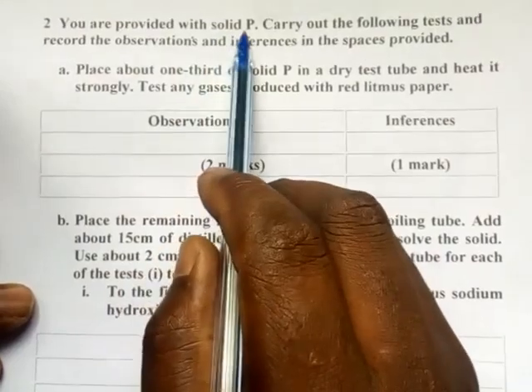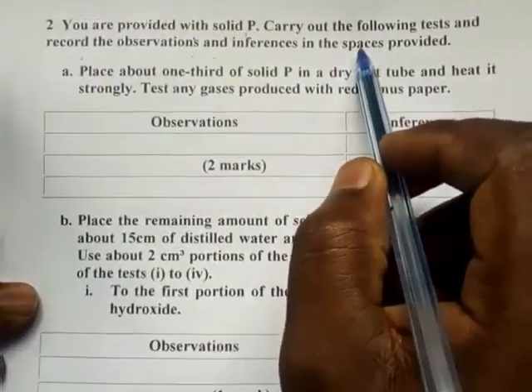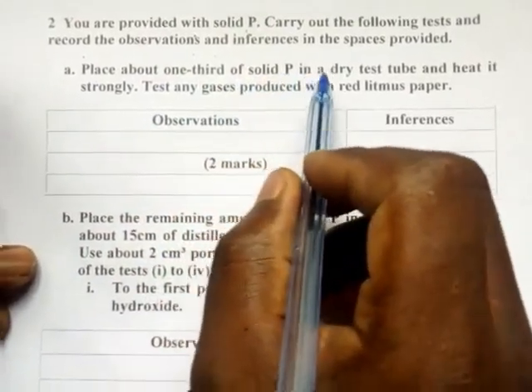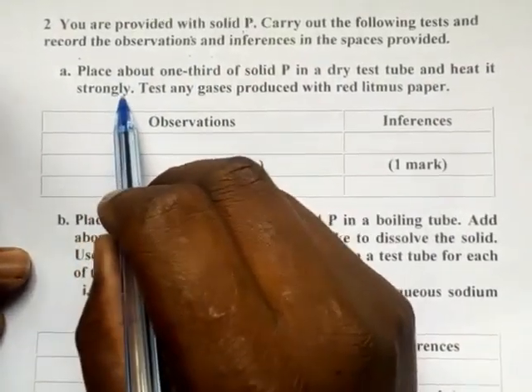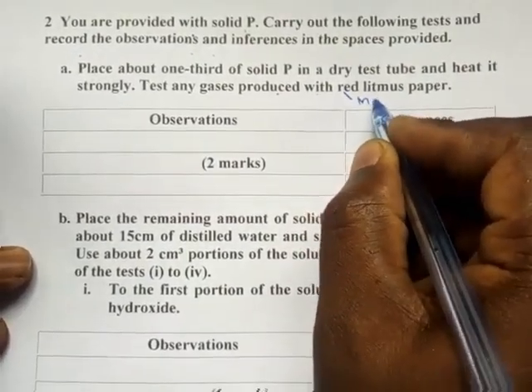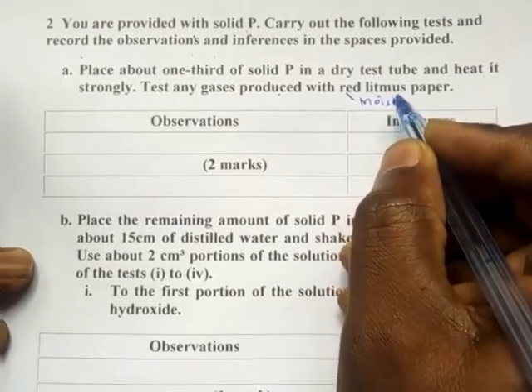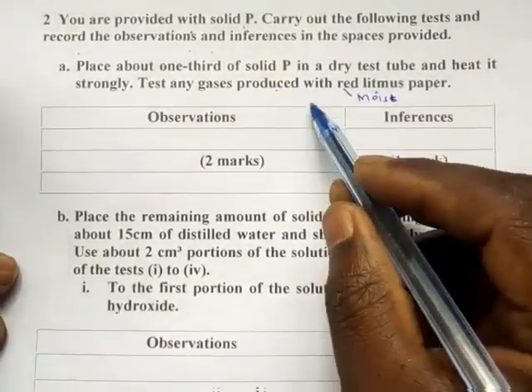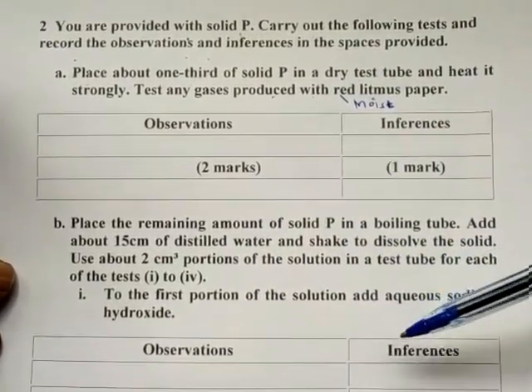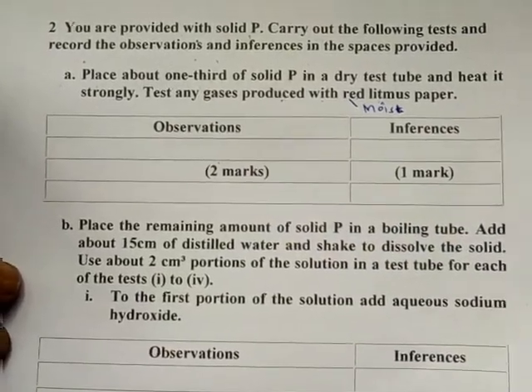You are provided with solid P. Carry out the following tests and record the observations and inferences in the spaces provided. Place about one third of solid P in a dry test tube and heat it strongly. Test any gases produced with red litmus paper — this red litmus paper must be moist, using distilled water, because otherwise you will not see any change. Before going through the question, first identify whether it is inorganic chemistry or organic qualitative analysis by going through the questions.